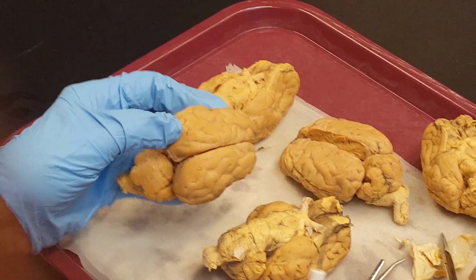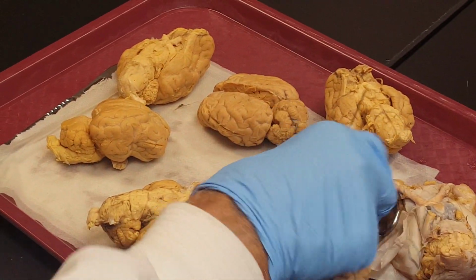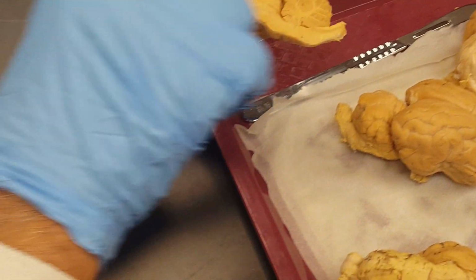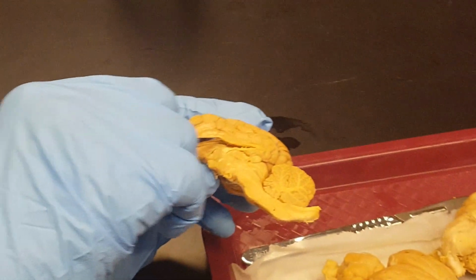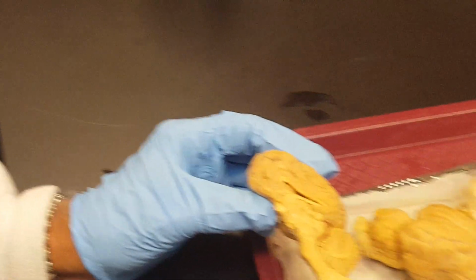Did I leave any other thing? Not here. Only the lateral ventricle I did. You have a ventricle model also. This is the lateral ventricle here. This is the cavity. Okay? What it is lined with, if this is lateral ventricle, and what I'm touching, what layer I'm touching.